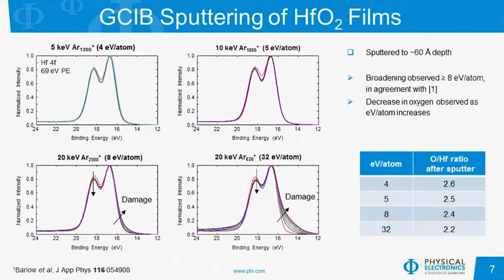We have also looked at the hafnium oxide, and in this case I have a hafnium oxide film that we sputtered to approximately 60 angstroms depth and used 4 different GCIB conditions ranging from 4 eV per atom in the top left figure to 32 eV per atom in the bottom right figure. And what we notice is that once we have the energy per atom at the setting of about 8 eV, we do notice there's a decrease in the peak intensity of the 4f5/2 peak, and we do see broadening to the lower binding energy side here.